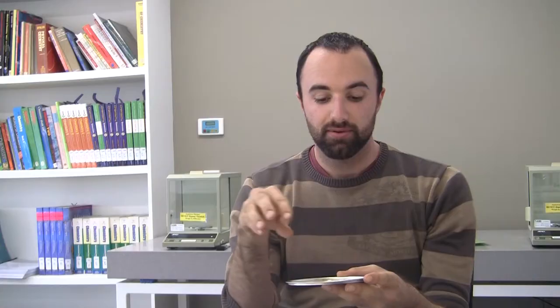You can actually grind up the potassium permanganate into different sized particles to have a comparison or talk about a comparison of reaction rates based on the size of the solid particles.